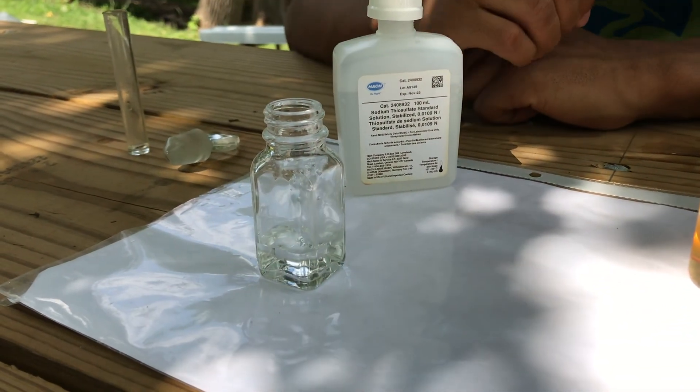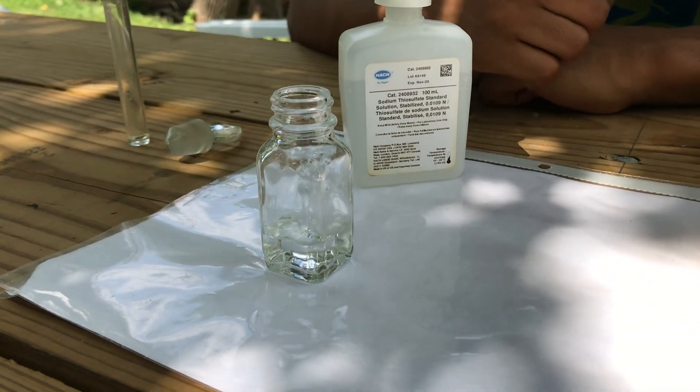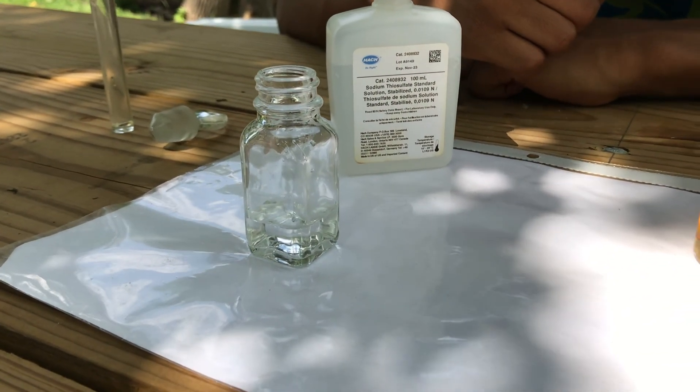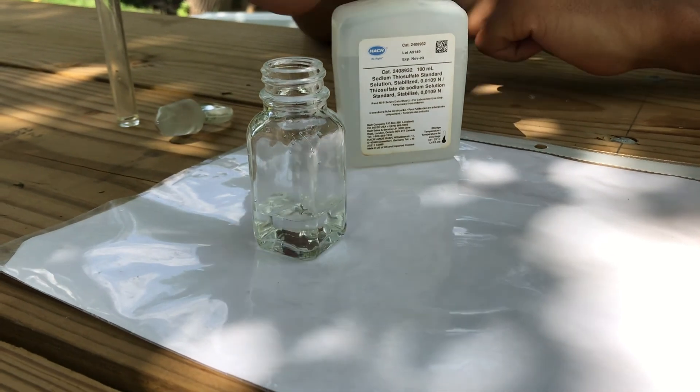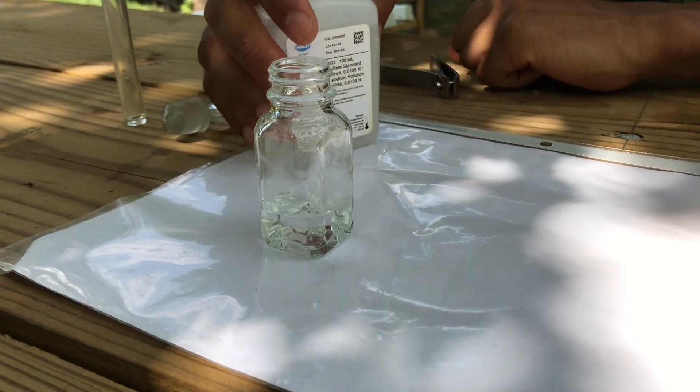So we can say that today, the dissolved oxygen in this water sample is 10 milligrams per liter.